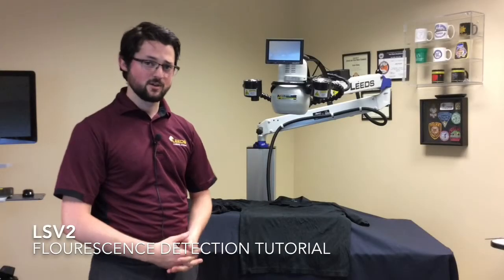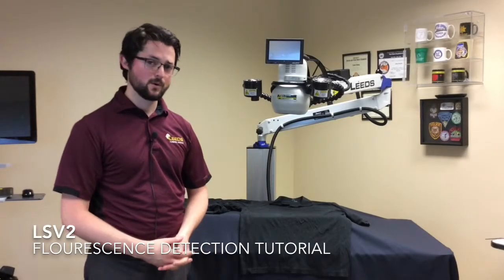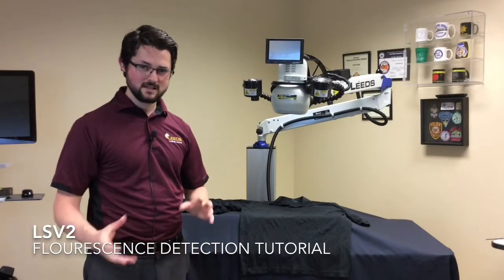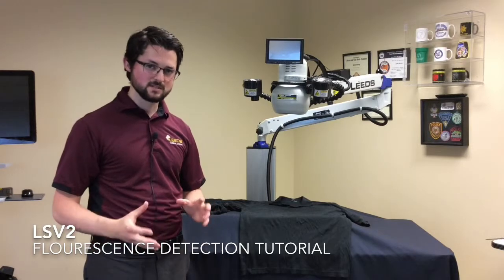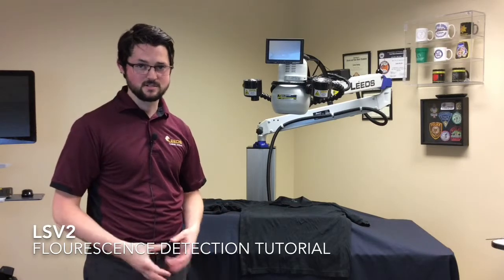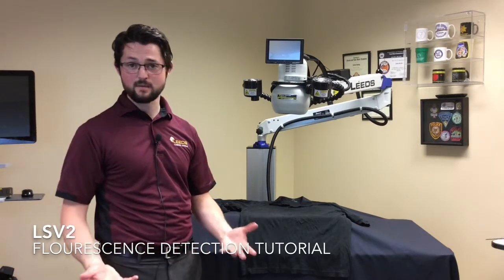Hi, my name is Jake Kurth. I work with Leeds Forensic Systems. Today I'm going to be discussing a little bit about fluorescence detection and how it works in the laboratory.